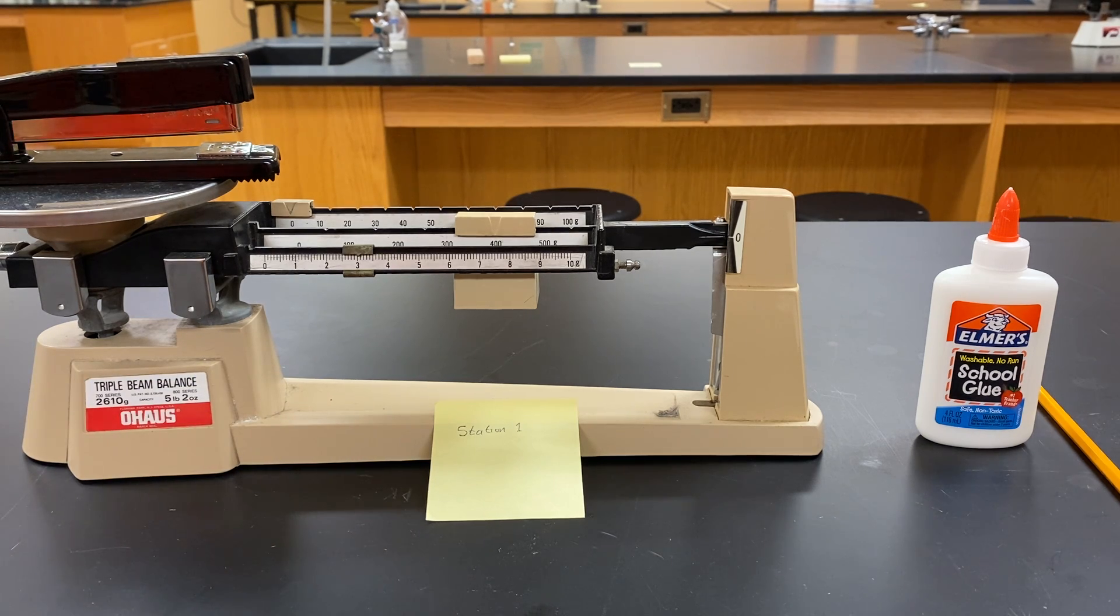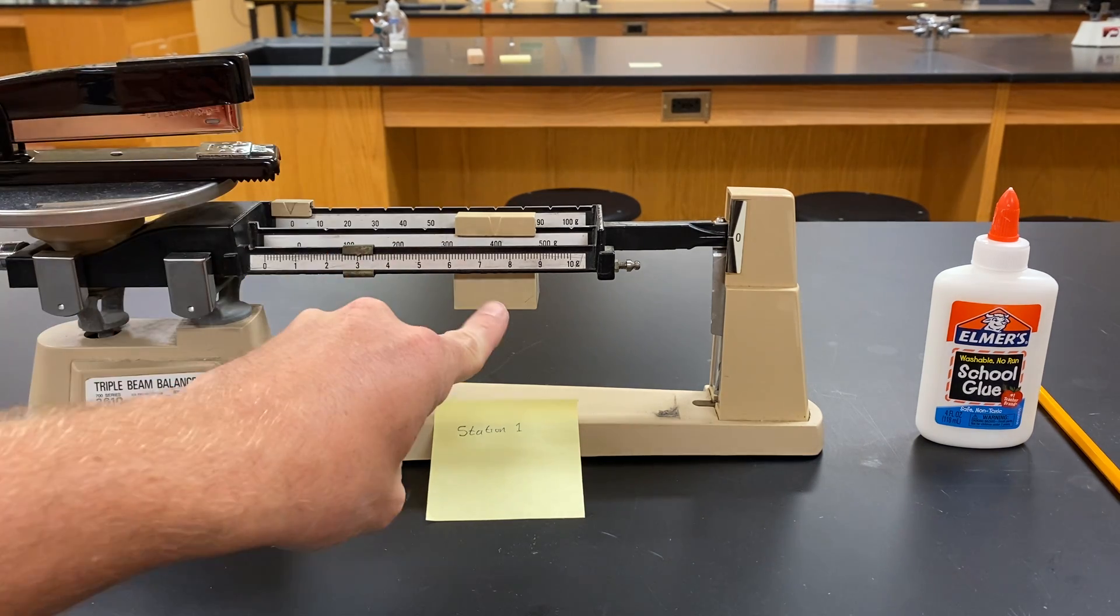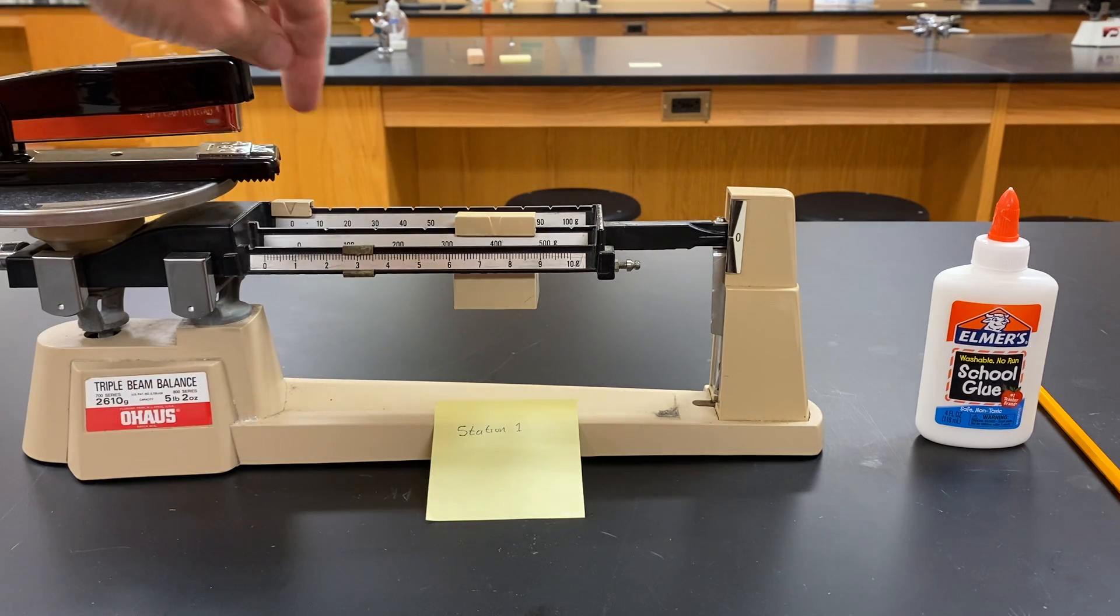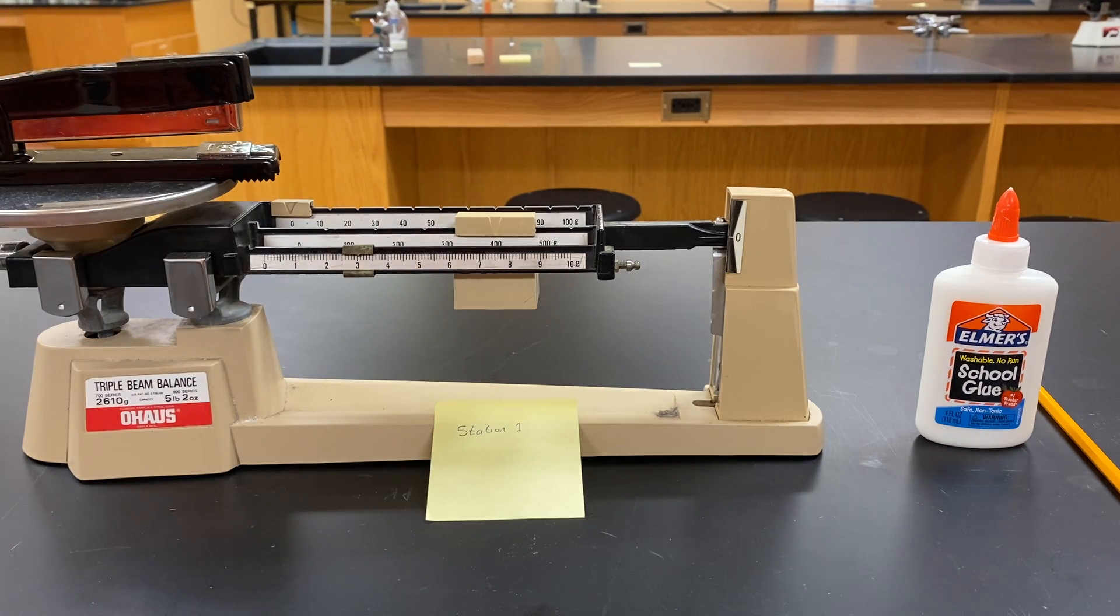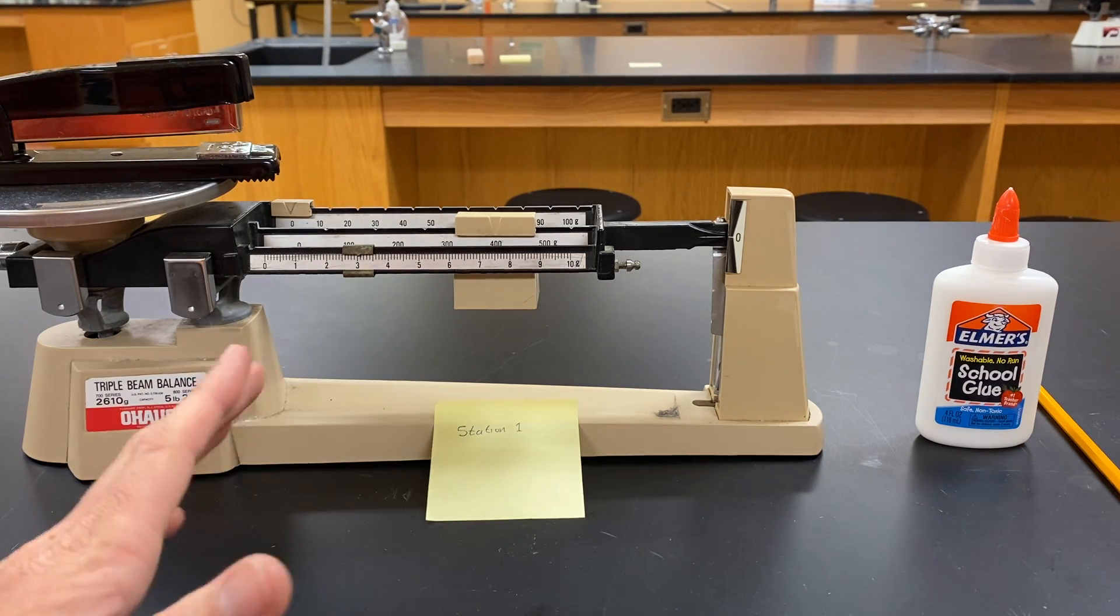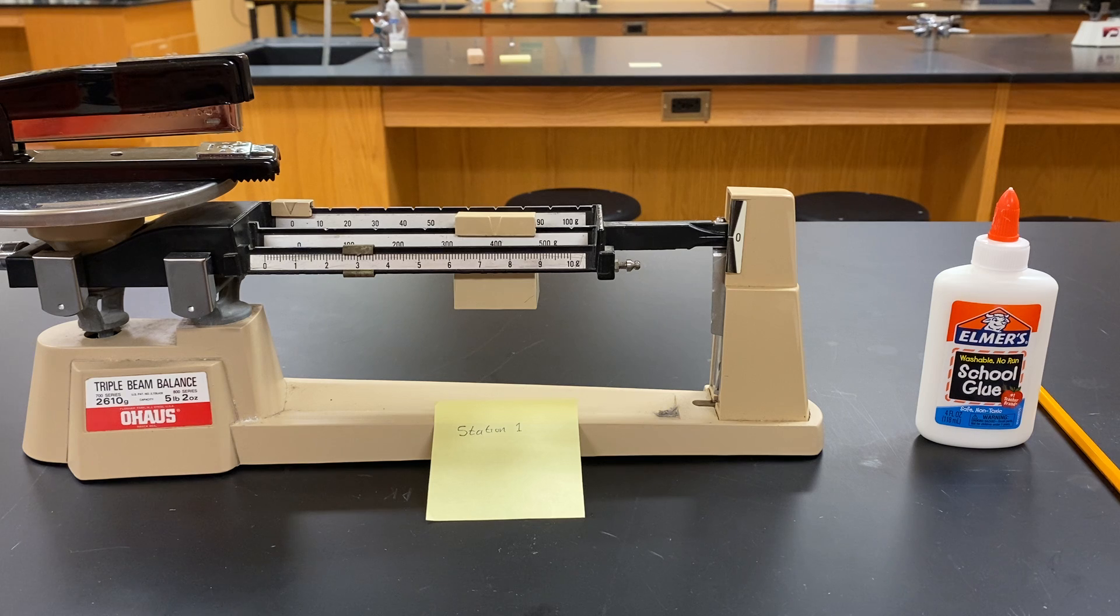Looks like we're balanced out. On here we're showing 400. We're showing zero here. And right here we're showing a little bit more than three. I will take a closer picture so you can evaluate what the weight of the stapler is.